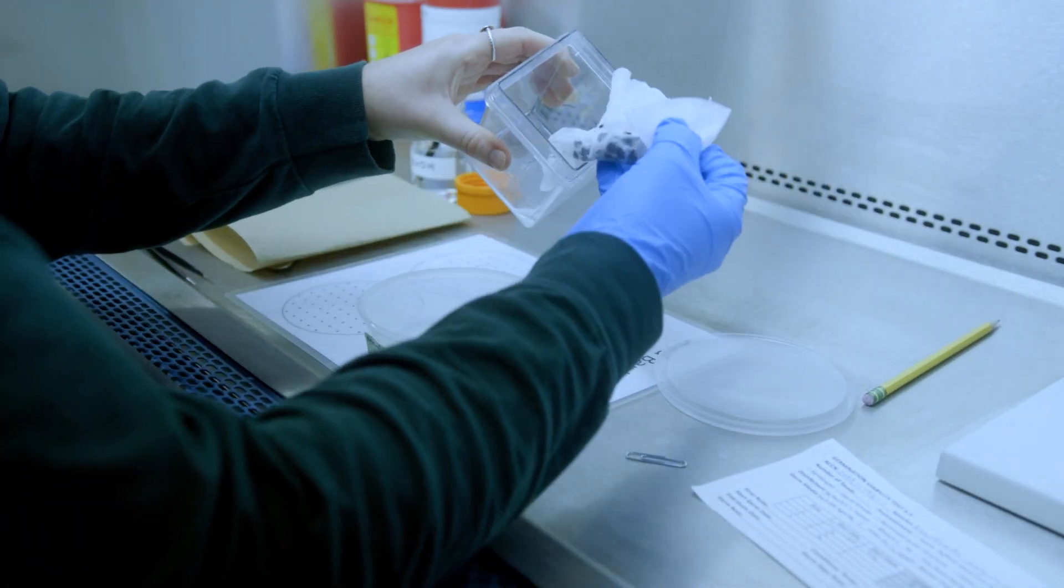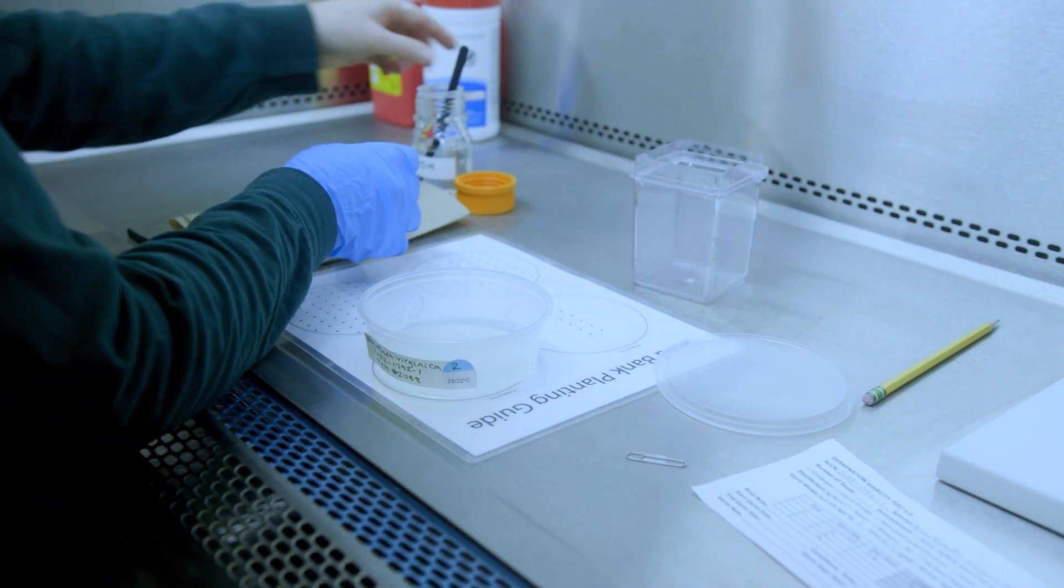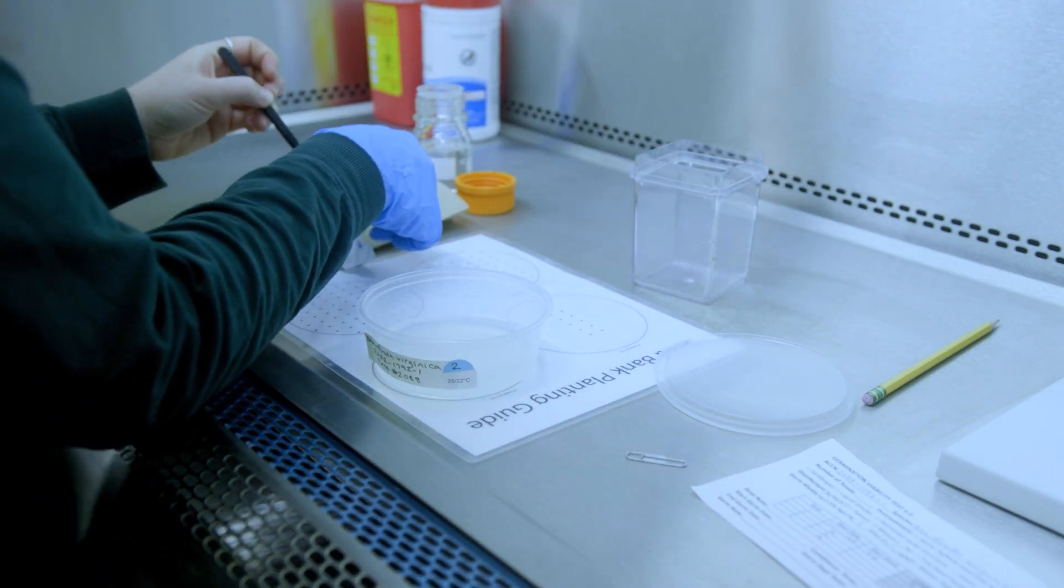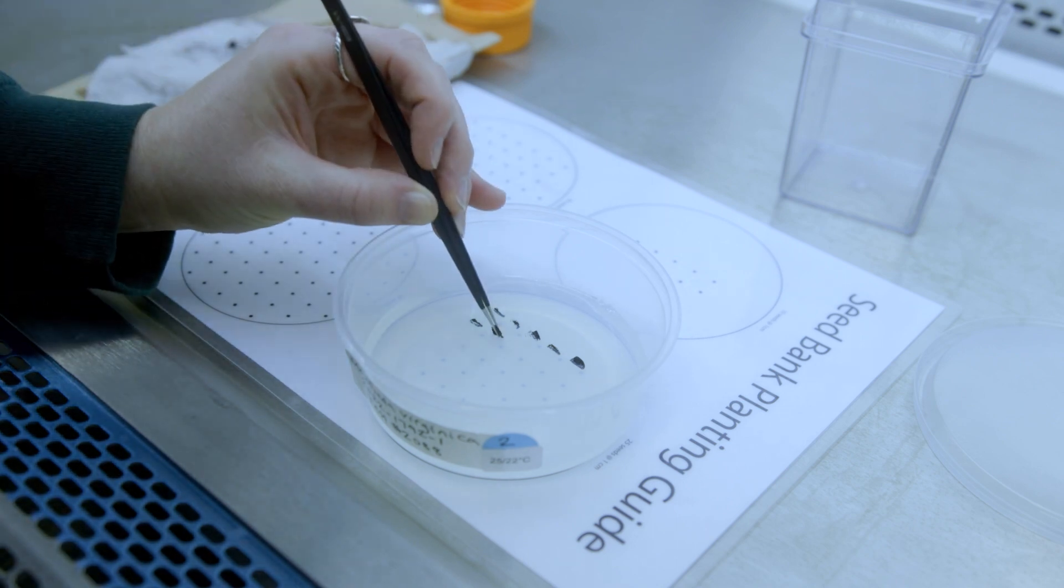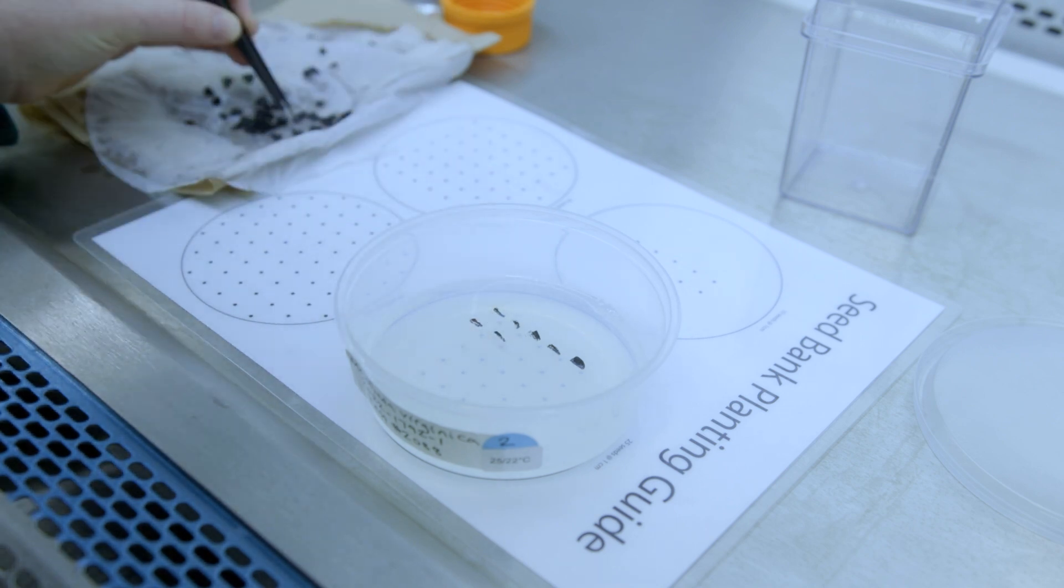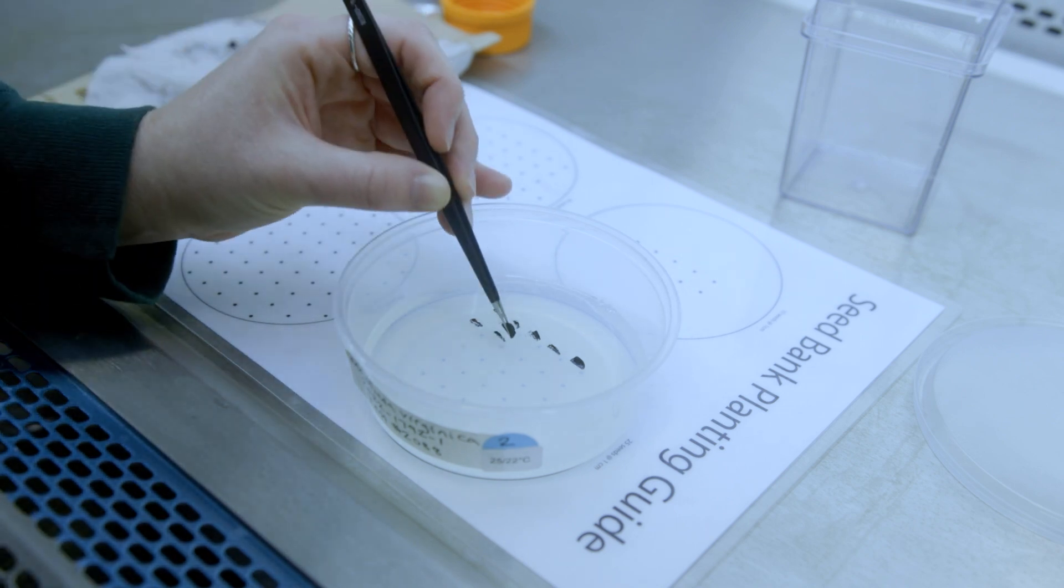The plate is placed on the seed planting guide. The filter gets laid out and the seed is planted directly from the filter paper. When planting multiple tests, forceps are disinfected in ethanol between each plate.